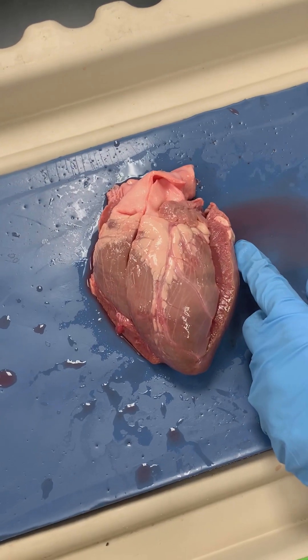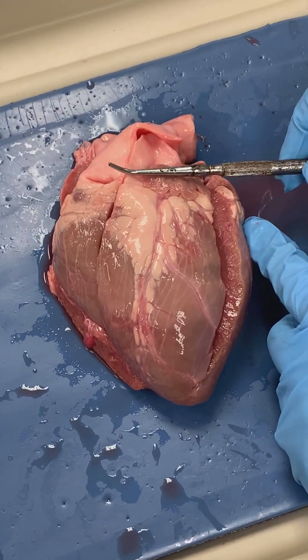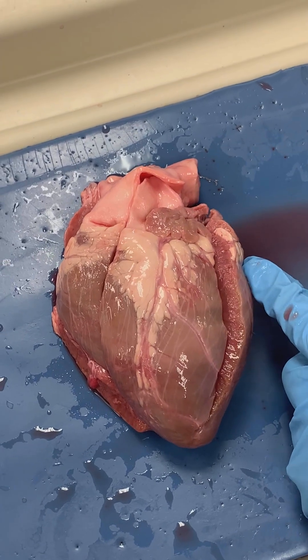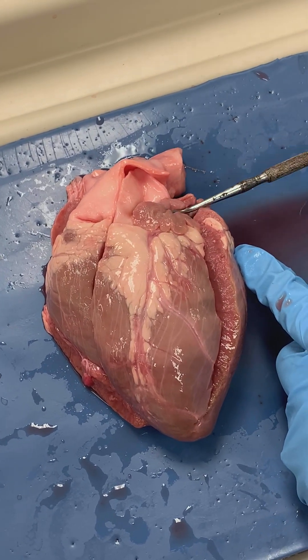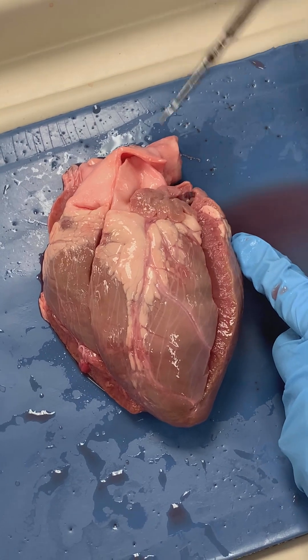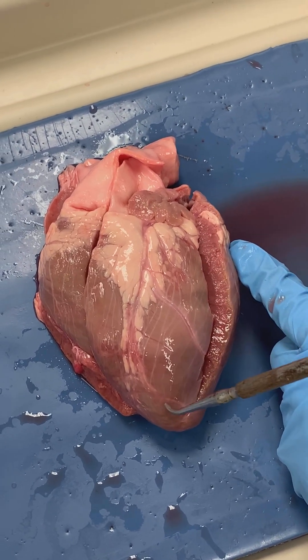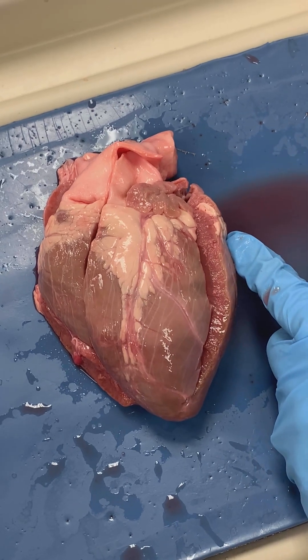We are again looking at the anterior surface of the heart and we have now made our third cut, which moved from the left atrium and cut down through our left ventricle moving towards the apex of the heart.